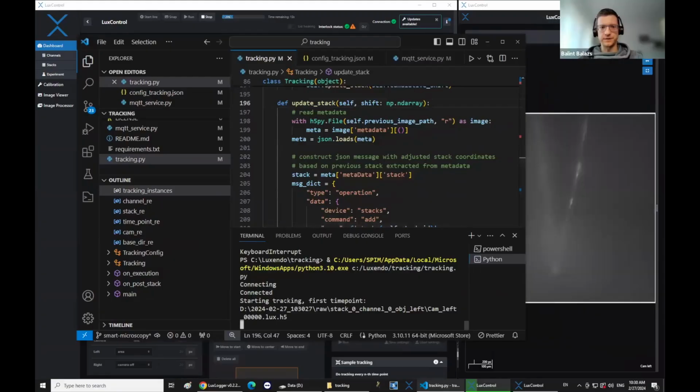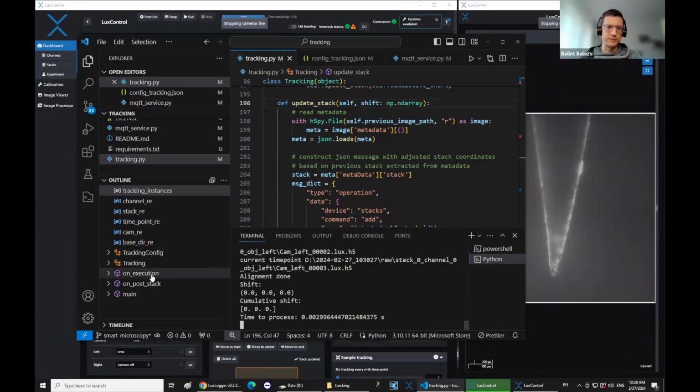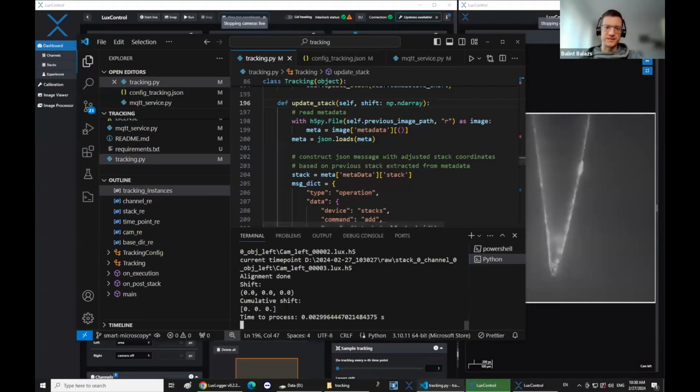Yeah, okay, so now it starts the tracking. This is the first time point. And then every time a new stack is finished, it does the alignment. So yeah, as I said, in this case, because I didn't find the actual registration script, it doesn't do anything. It just always returns 000.